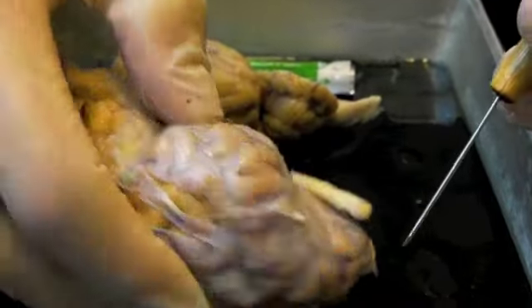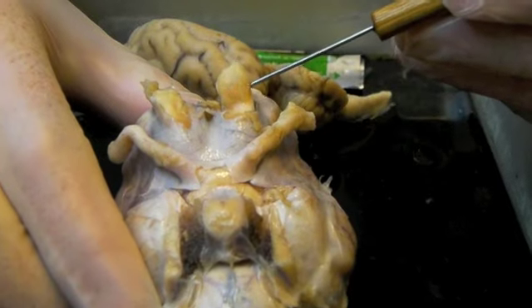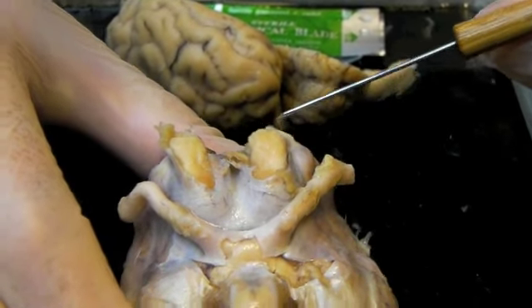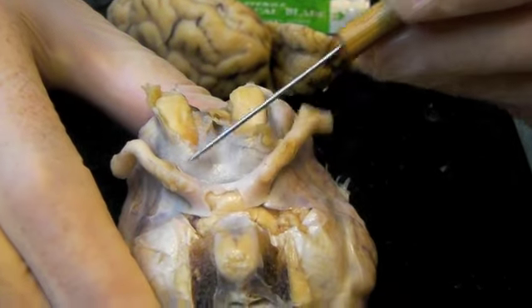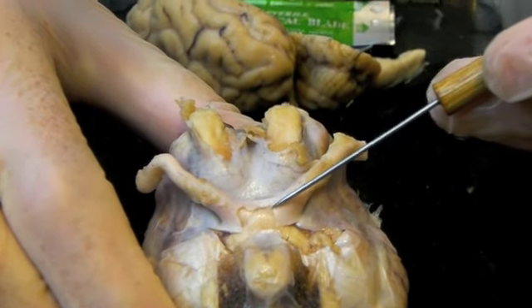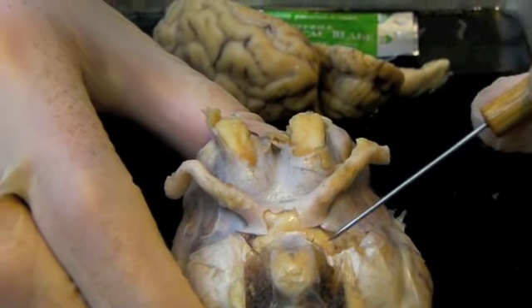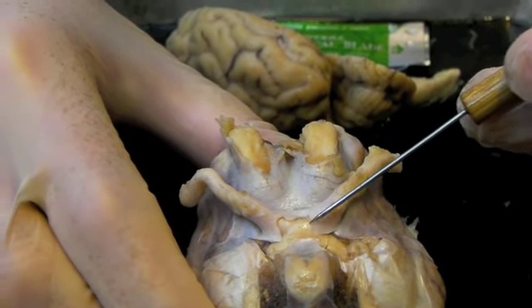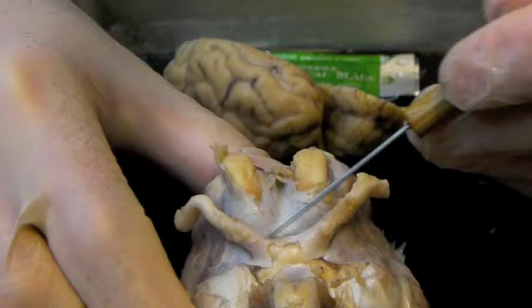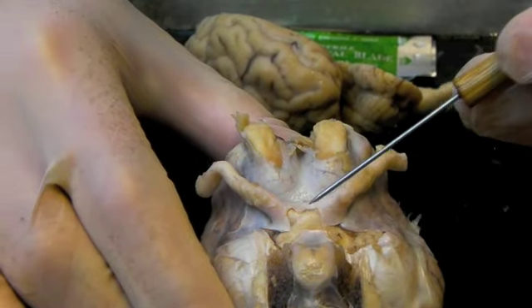That's a superior view. From an inferior view, the first thing, going from anterior to posterior, these are the olfactory bulbs, which are cranial nerve number 1 for sense of smell. These are the optic nerves, cranial nerve number 2, taking in the sense of light. The two optic nerves come together in a structure called the optic chiasm, where some of the light rays are going to pass from one hemisphere to the other. And then they continue back as the optic tracts to the occipital lobe. So it makes an X here. So optic nerves, optic chiasm, optic tracts.